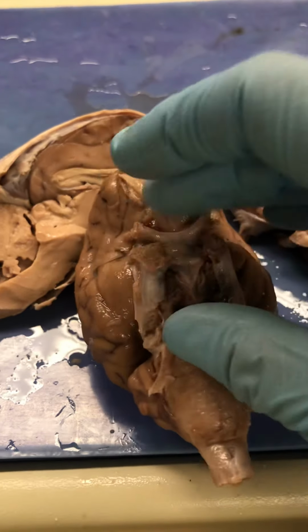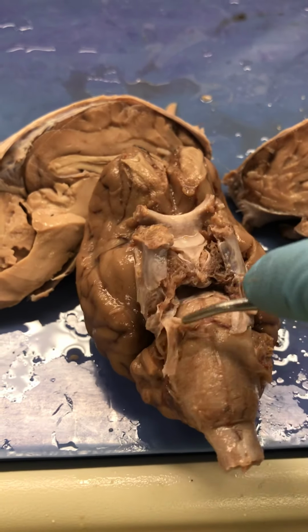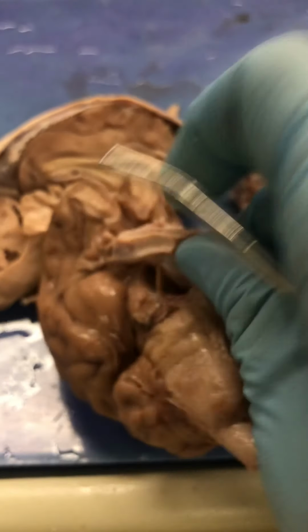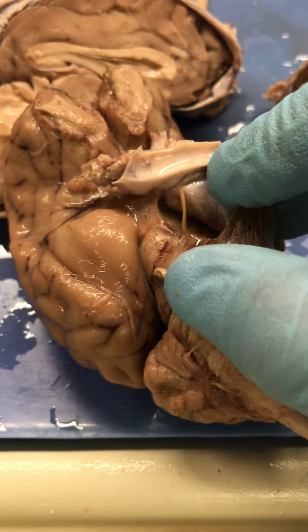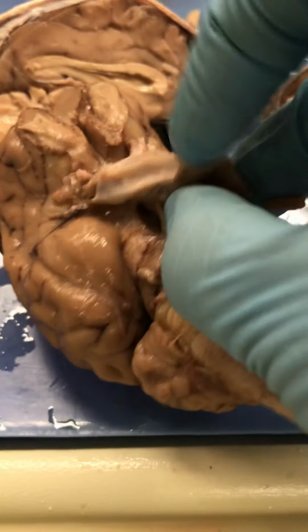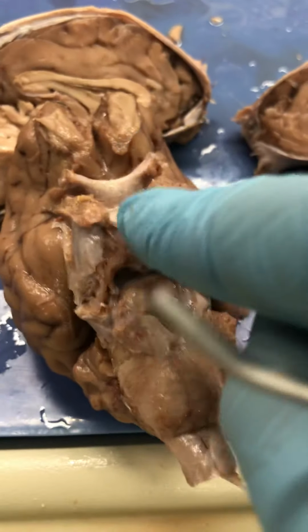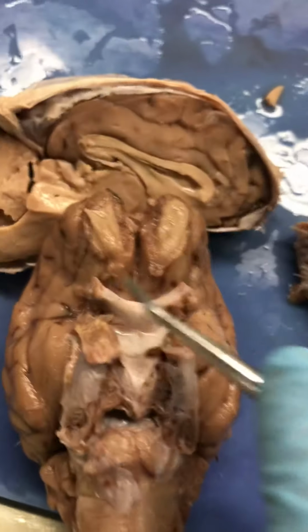That's your pons, and those of you who are studying mammillary bodies, they're going to be under the pituitary gland. You see how there's a cranial nerve there? The mammillary bodies are under there, but I digress. Pituitary, pons. This is the optic chiasm as well that I've showed you.